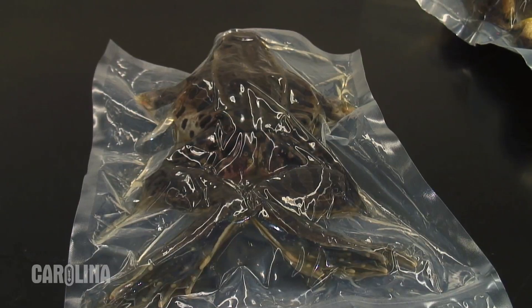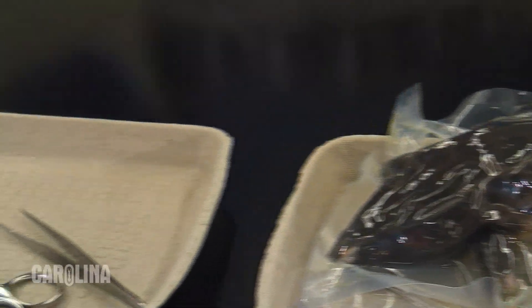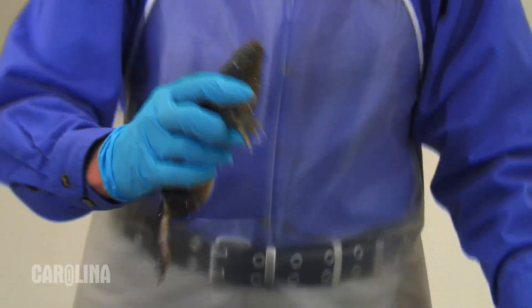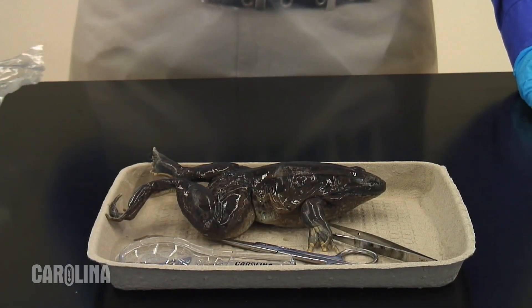I'm putting on my personal protective equipment now. Remember to always model good safety practices. There are two options for vacuum packaging: one per bag or bulk bags. One per bag packaging is ideal for convenience. The bags are easy to open and can be easily distributed to students. Bulk bag packaging is great for teachers who would like to use multiple specimens at once, and it also offers a quantity pricing benefit.